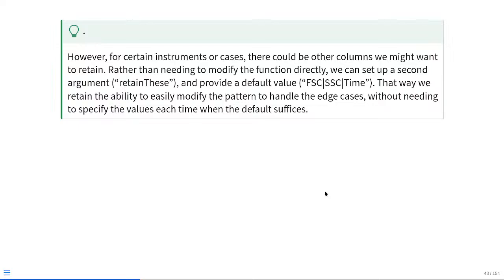However, for certain instruments or certain cases, there could additionally be other columns that we might want to retain beyond just forward scatter, side scatter, and time. Rather than then needing to go open up the function and modify it directly, it would be better if we had a new argument, in this case a second argument, something called like retain these. And then, because we don't want to have to start rewriting forward scatter, pipe, side scatter, pipe, time each and every time we run our unmixing function, we could just provide a default value of that. That way, we're just able to handle any edge cases as we encounter them without needing to specify new values each and every time.